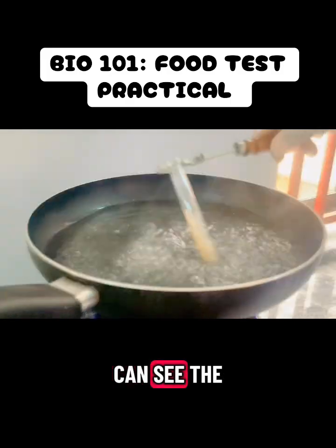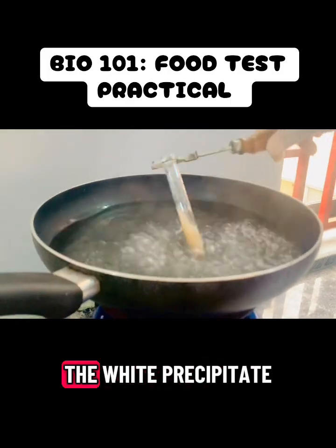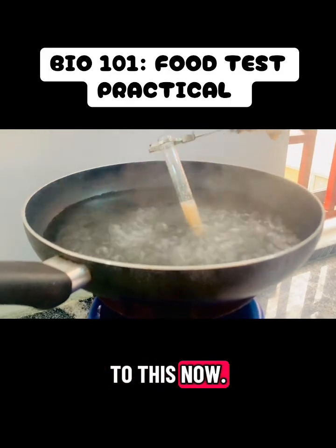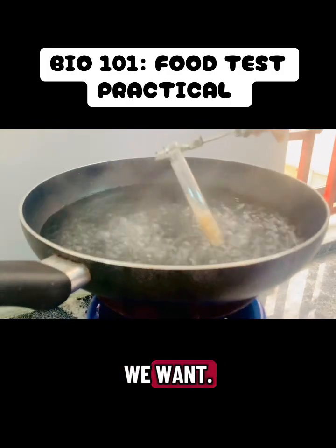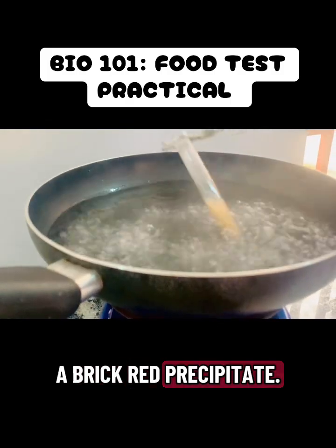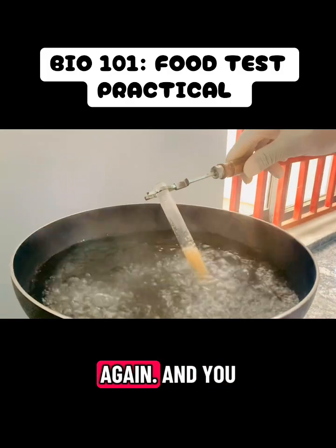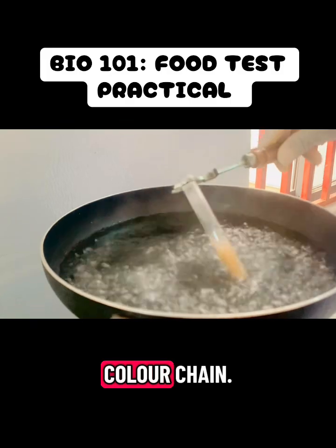So yes, you can see the color change. It has moved from the white precipitate to this now. Yep, but this is not what we want. We are expecting a brick red precipitate, so we will be heating up again, and you can see the color change.